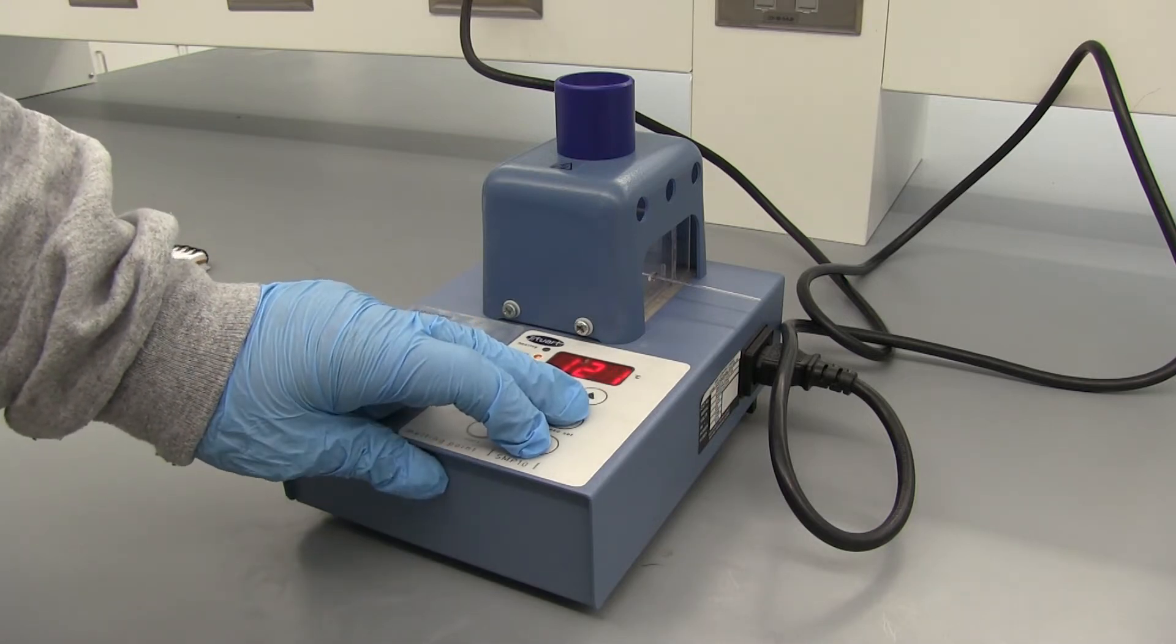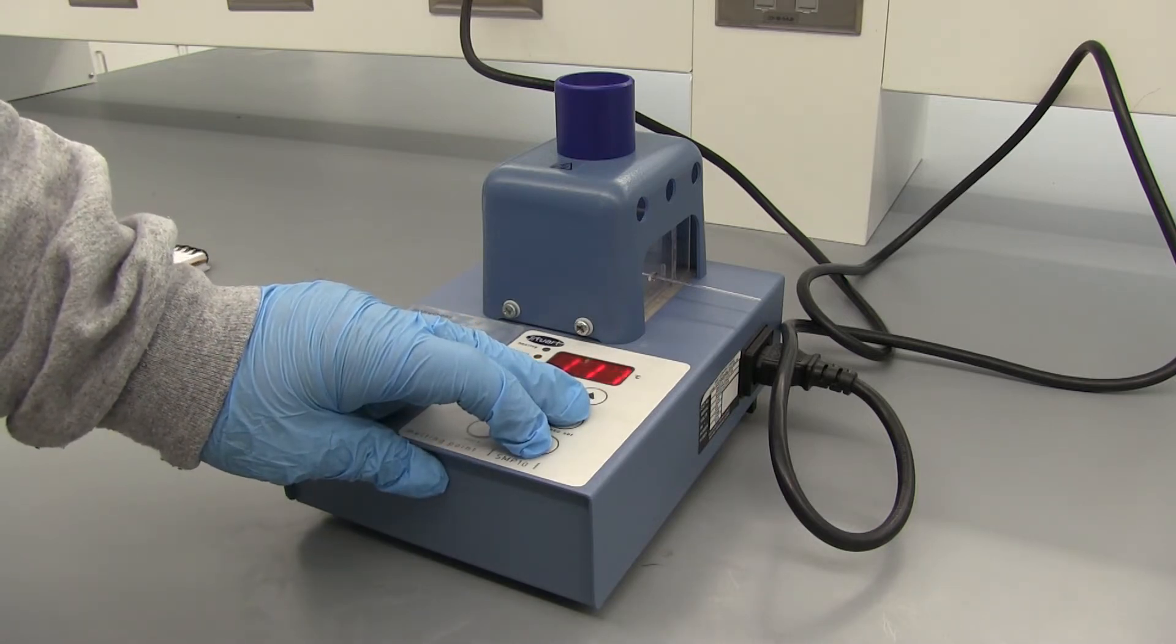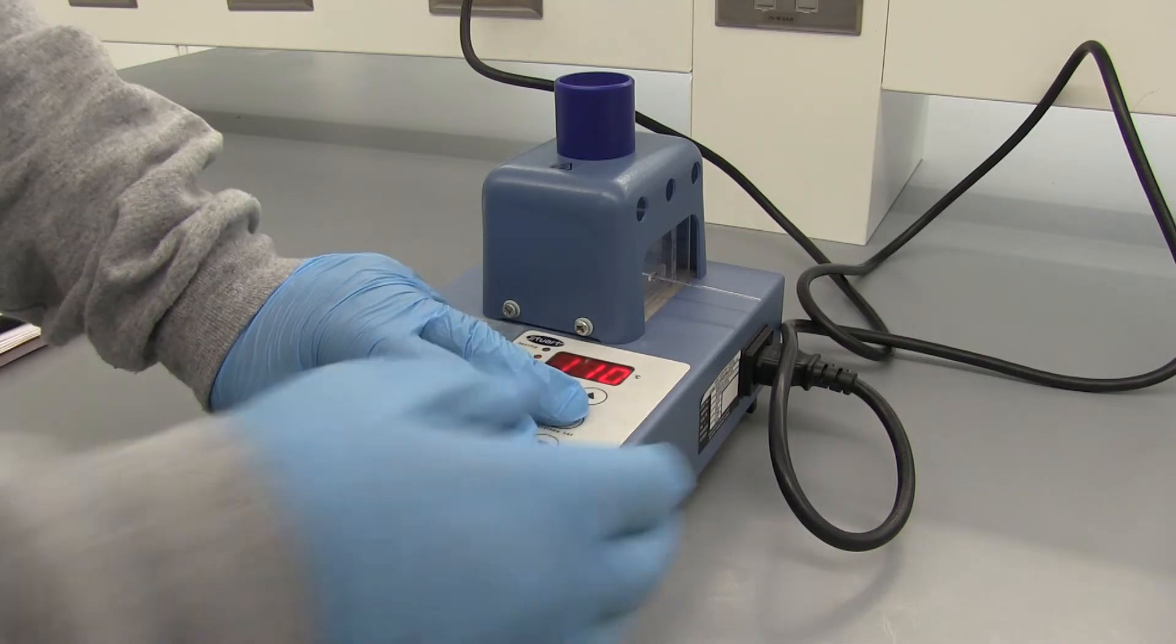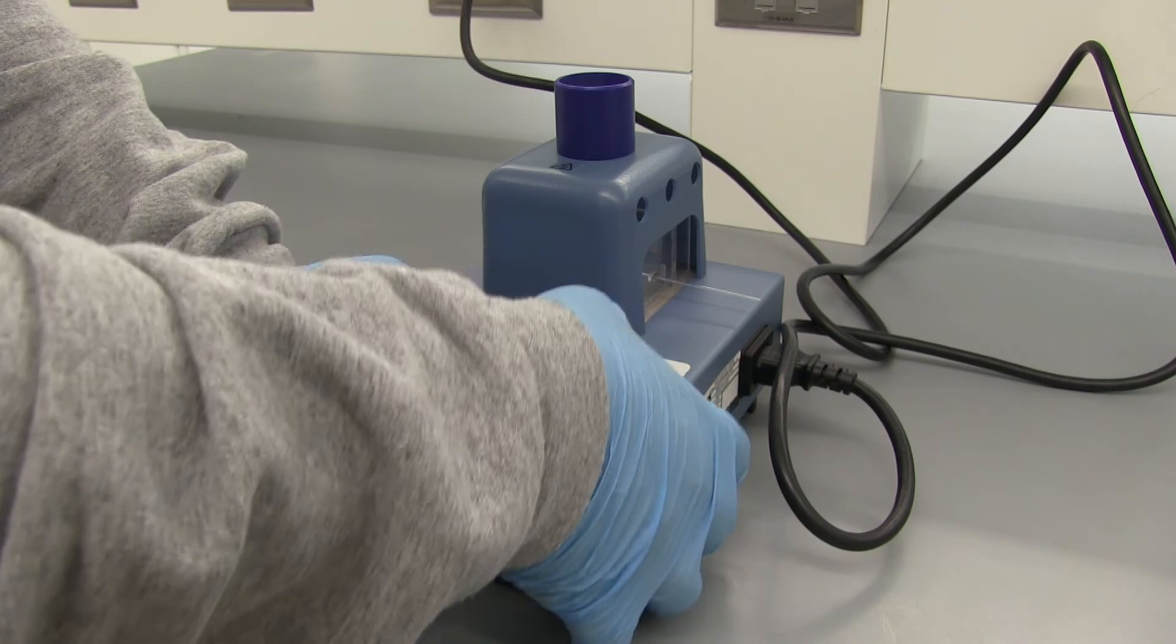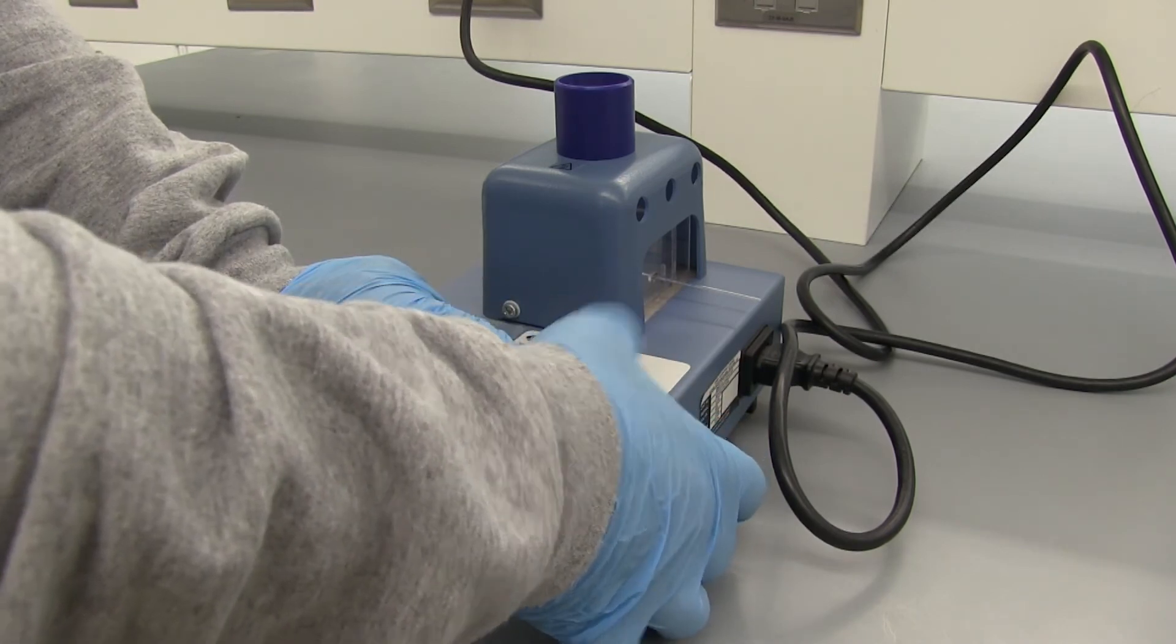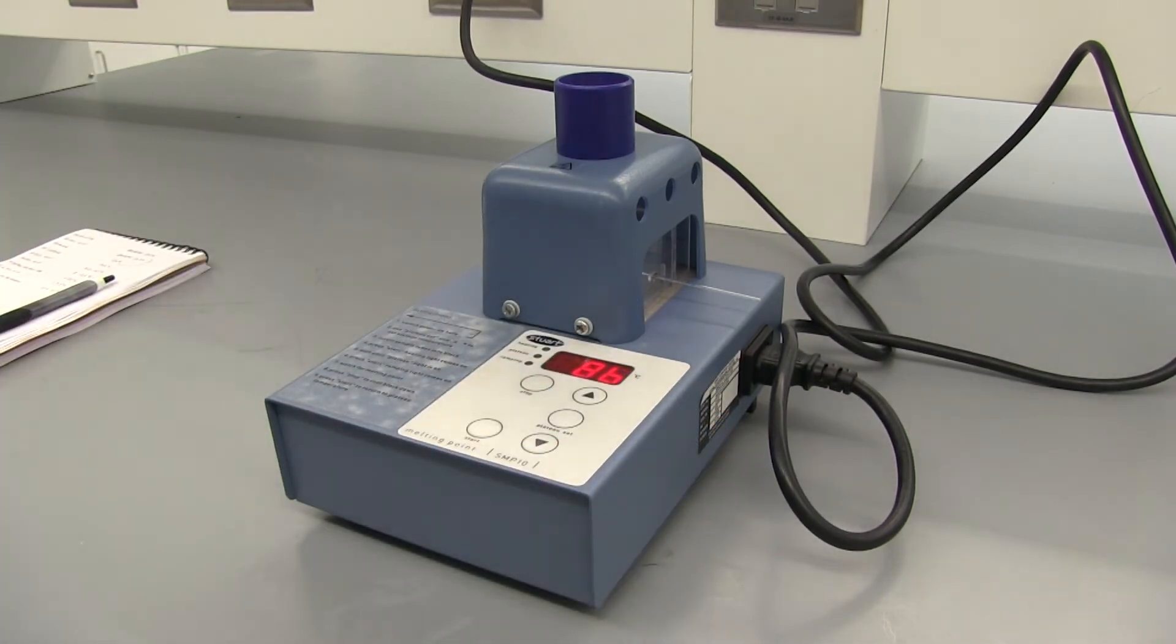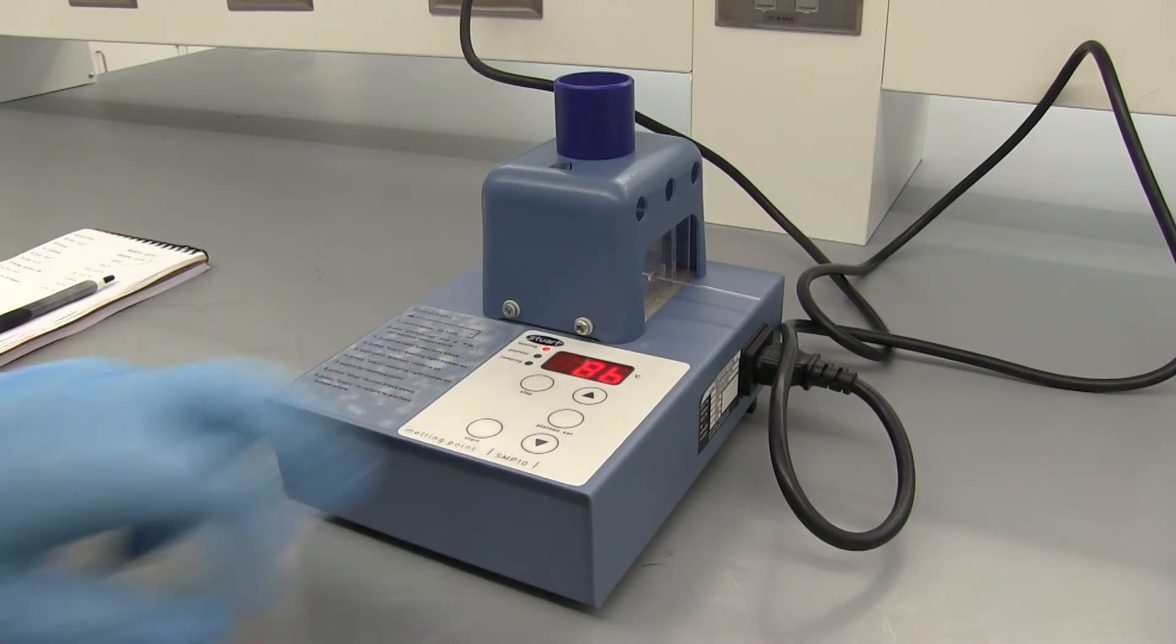So I think it's either one of those two. They're both pretty similar in appearance. So we're going to go I think 120 is a good start. If it does start melting beforehand we can do another slow melting point. So I'm going to go ahead and press start and find out the slow melting point.